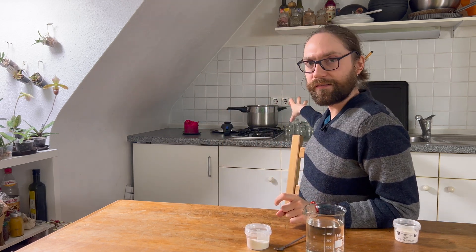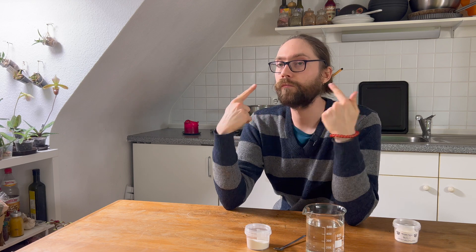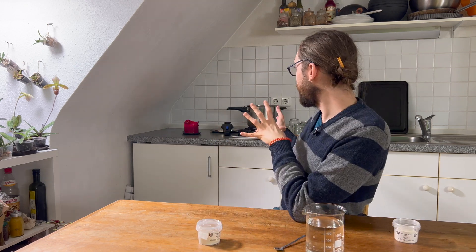If you look behind me, I already have some glasses ready that I will pour the media into, and it's going to be sterilized in this pressure cooker. The first thing to think about with any culture is what media to use. This media is going to be very prone to growing fungi. So what I want to do is sterilize it. This will be done in the pressure cooker because under pressure we can reach a higher temperature with the water vapor inside, and this will ensure that any microorganisms present — including spores — are eliminated. Hopefully our media is going to stay nice and sterile.